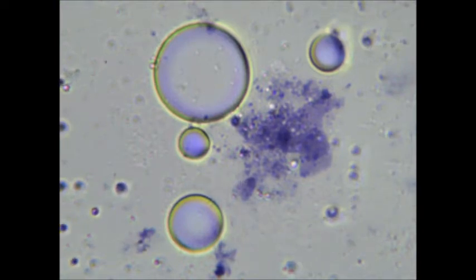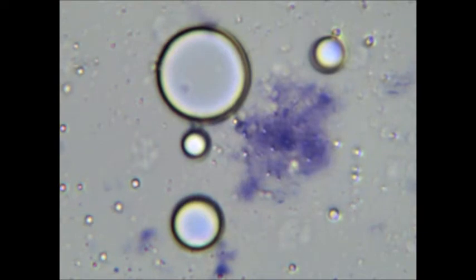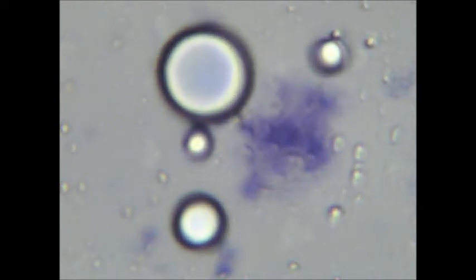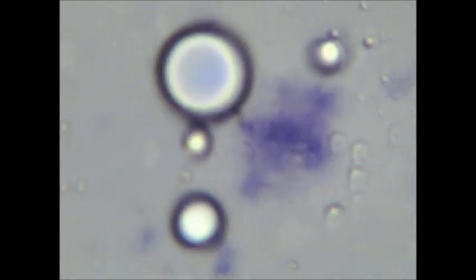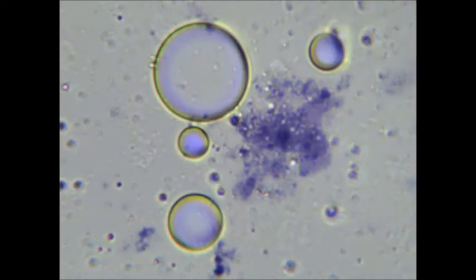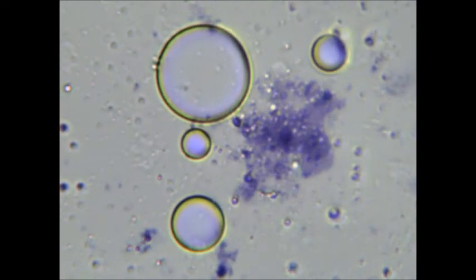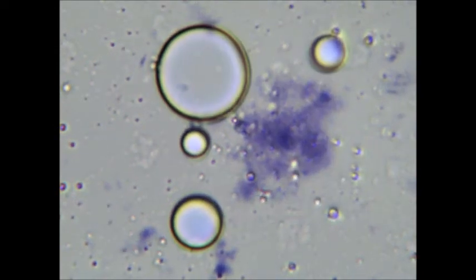I used hematoxylin because it binds selectively to nucleic acids. And so based on this video, one might hypothesize that the RNA bases have indeed collected inside the vesicles.